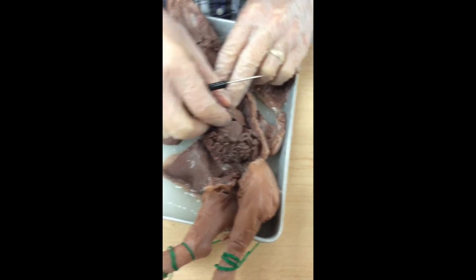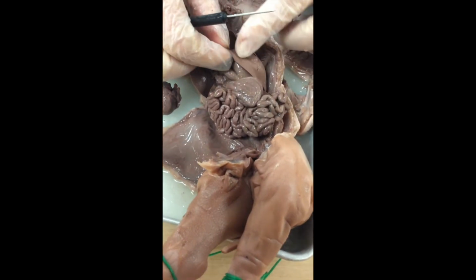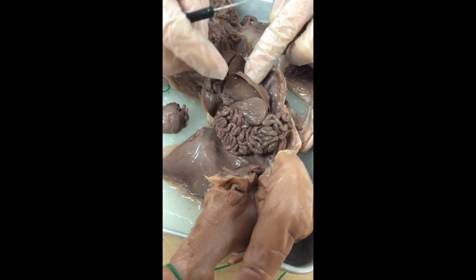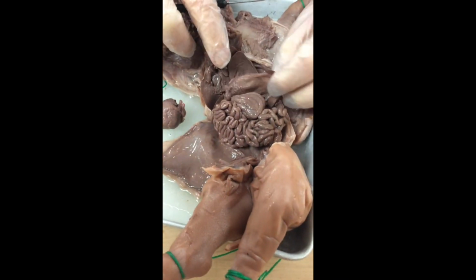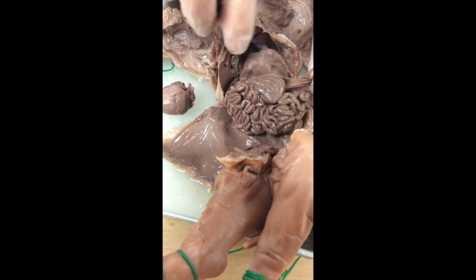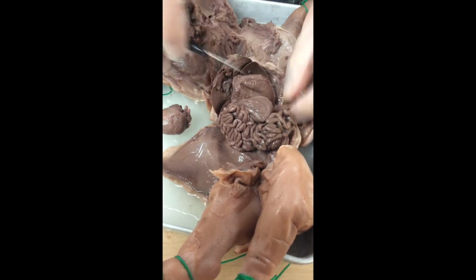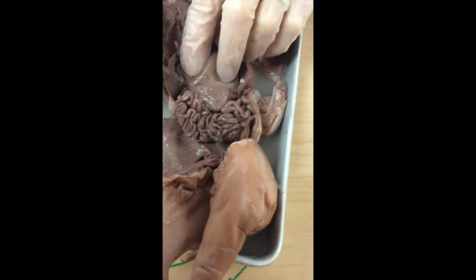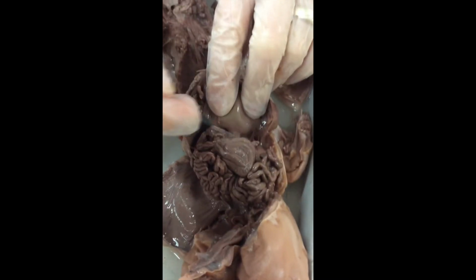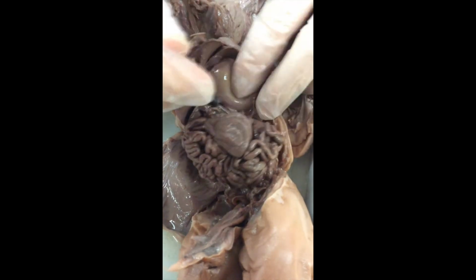You see that there's a tongue-like structure on the left side of the stomach. This is the spleen. One of its primary jobs is simply to store extra blood for us. So if we got in a catastrophic accident, we'd have some reserves, like a Red Cross right there inside of our body with the spleen. All right, I'm looking down below the stomach, and that proper terminology would be caudal, exposing this out a little better for us.